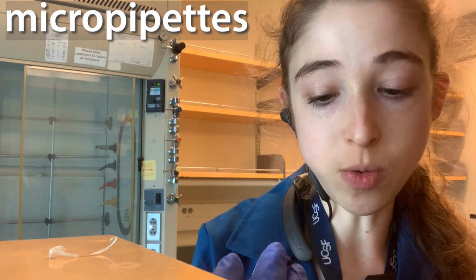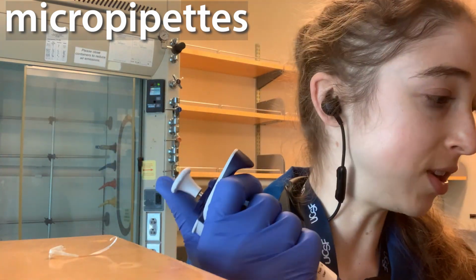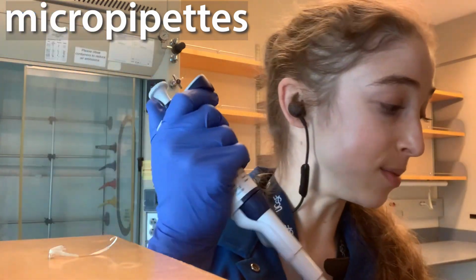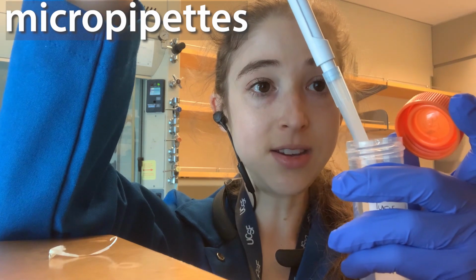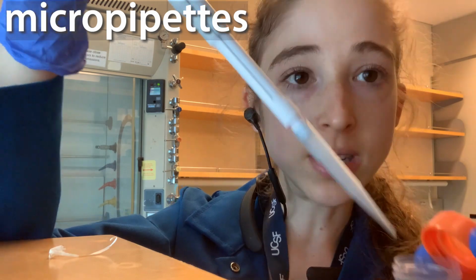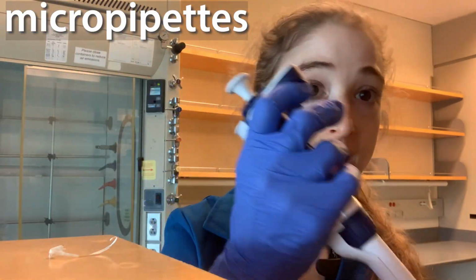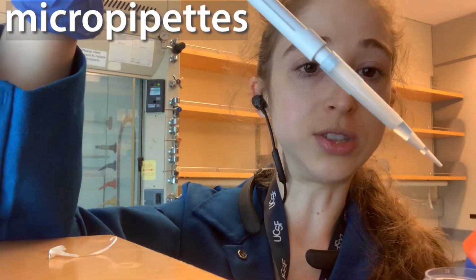Another thing when you are pipetting is, I know it sounds stupid, but you want to make sure that you actually see that there's liquid coming into the pipette and going out. It's really easy, especially when you're working with small volumes, to just put your pipette in here and think you drew up the liquid, but really you just drew up air. So you want to take a look and make sure it's really in there, and also that when you're releasing it, it's getting all the way out, without accidentally sucking it back up. You don't want to work too quickly, and then pull up and it's still in your pipette.